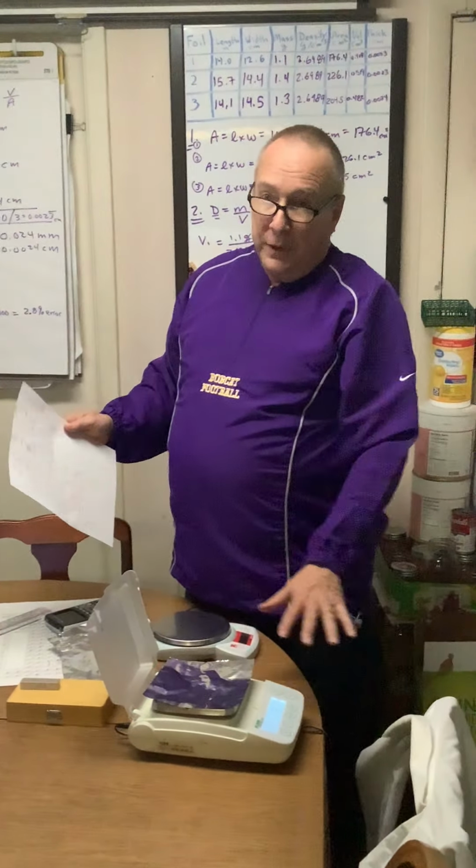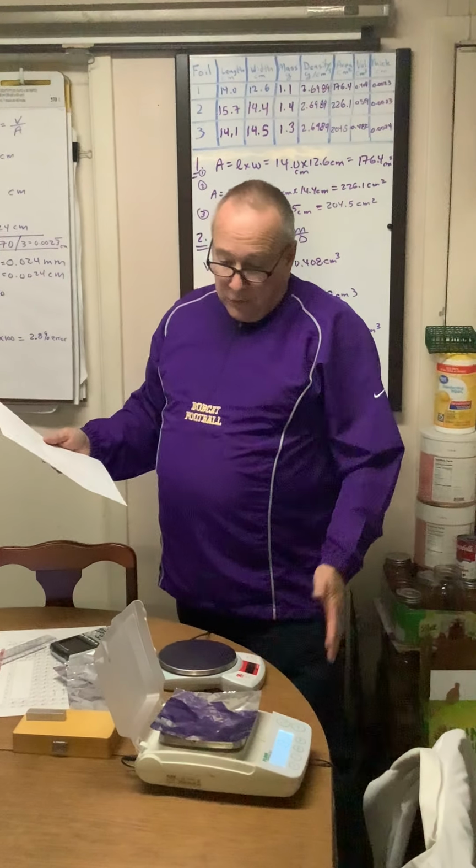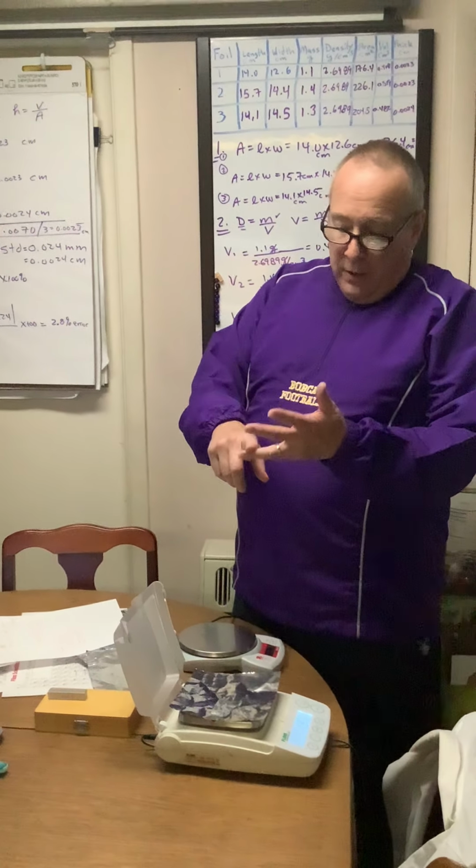You have to let your balance settle and do repeated measurements to make sure you're not under an air conditioning vent blowing down and you're measuring the force of the air blowing down. So another question is the balance calibrated? So, crinkled foil, rectangles that don't have 90-degree angles, uneven cuts, air currents with the balance and uncalibrated balance, all those could contribute to our sources of error.